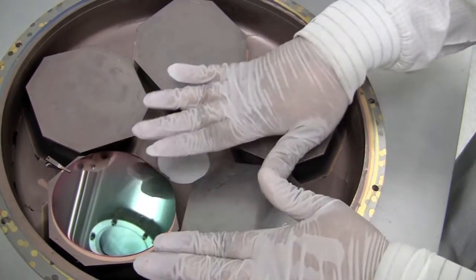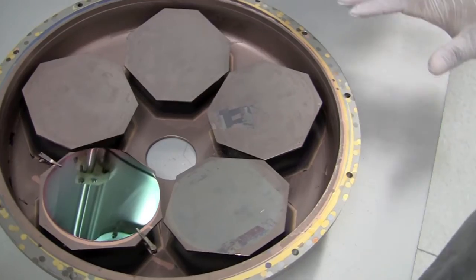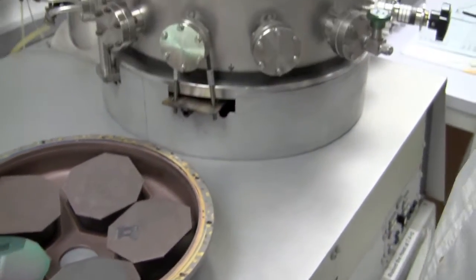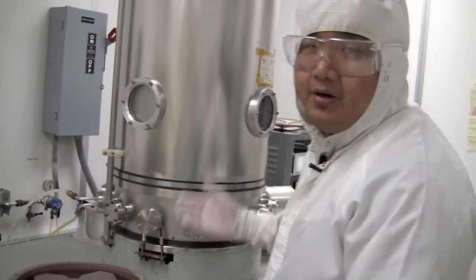So once you've mounted your wafer and you want to put it in the system, you would need to vent the system because right now it's in high vacuum. So we're going to vent the system.